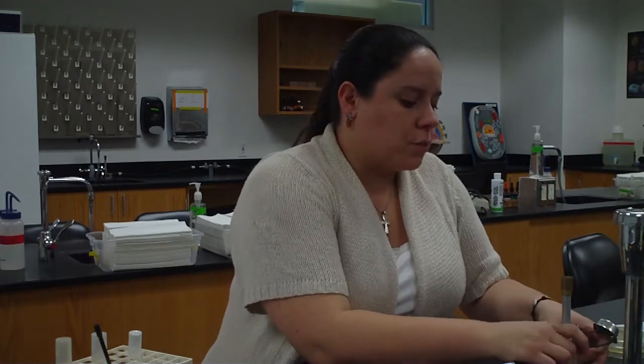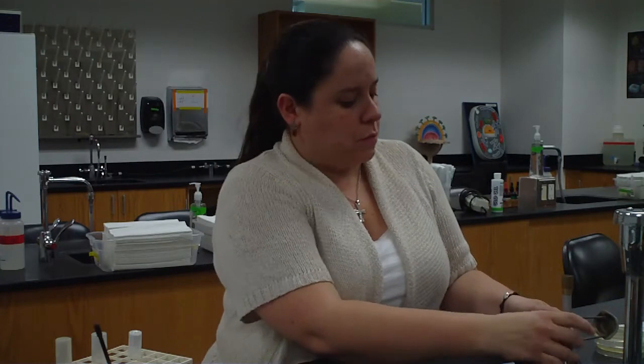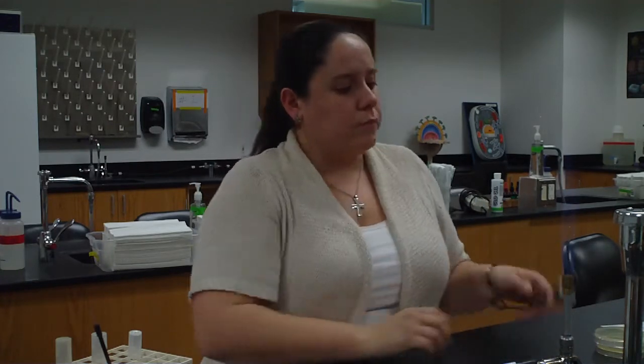We're going to turn on the gas. Okay, so we're going to turn on our gas jet. Make sure our Bunsen burner is open. I can hear the gas actually coming out. And don't be afraid of the Bunsen burner. A lot of people are kind of afraid to turn it on. If I get a good spark, let's open that up a little bit more. There we go. So now our Bunsen burner is on.